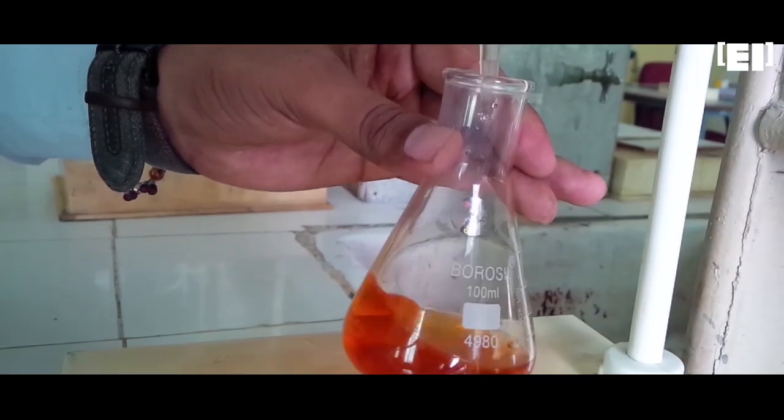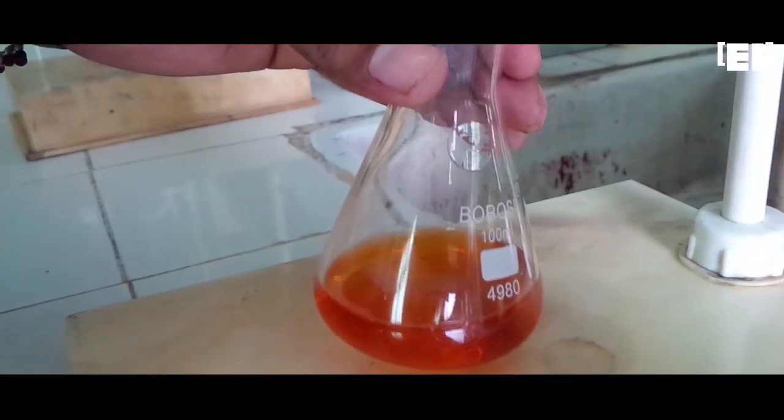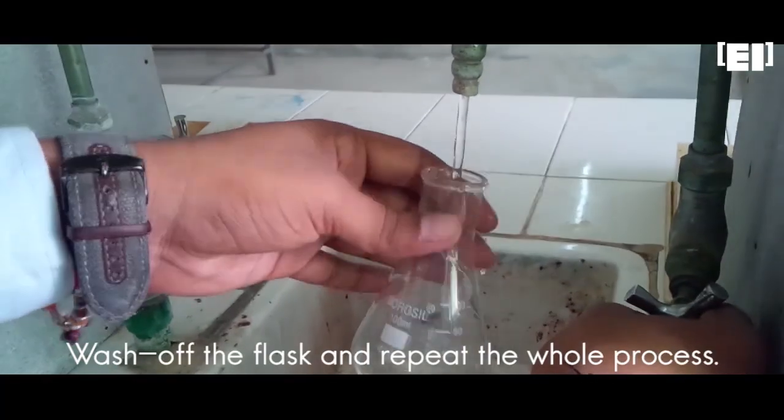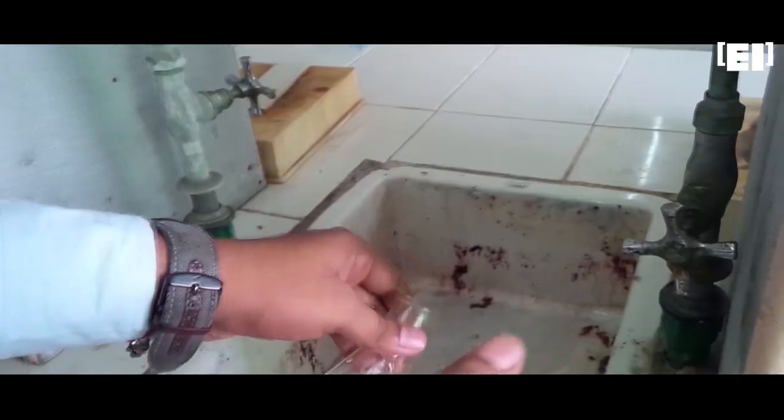The bright red color has appeared and this marks the end of titration. So, note the reading. Wash off the flask as we are going to repeat the process for concordant values.